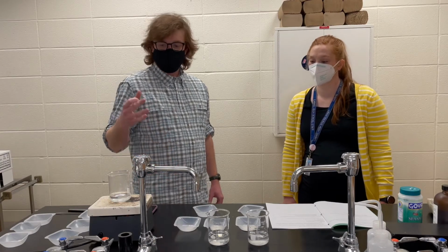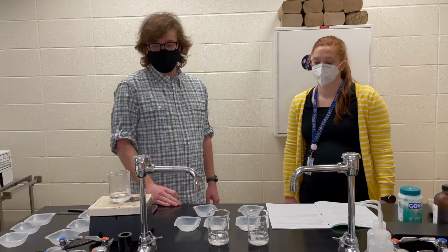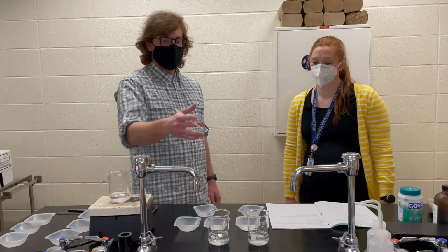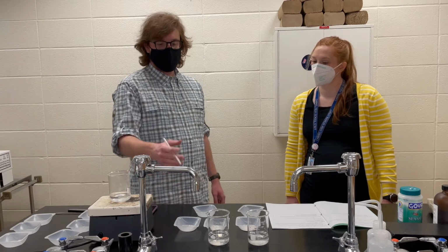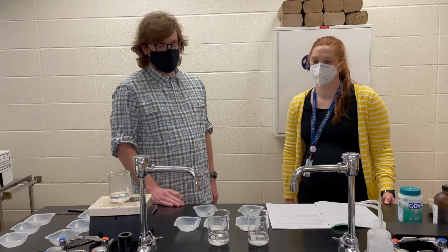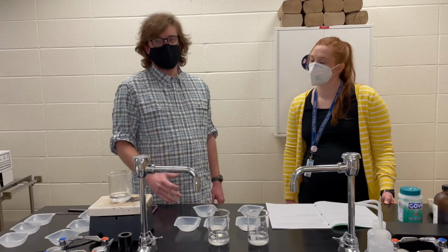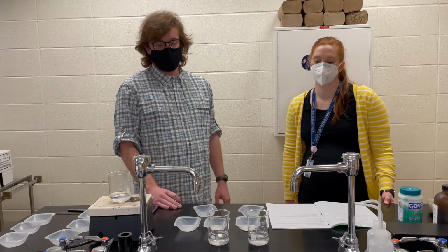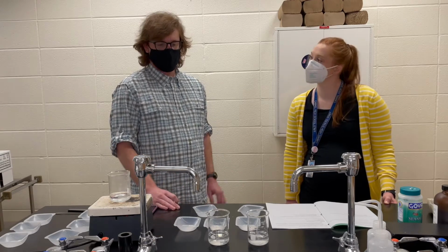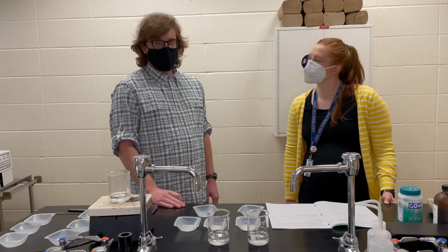In part 1, we're going to look at different temperatures of the water, see how that affects solubility. So I've got a beaker warming up, got one in an ice bath that's kind of tucked away, and then we have some at room temperature. We're going to look at the various salt sizes, or the sizes of the crystals, and then we're also going to look at agitation, so stirring versus not stirring. And then we'll do a 4th part that's a little bit different. Let's go ahead and get started.